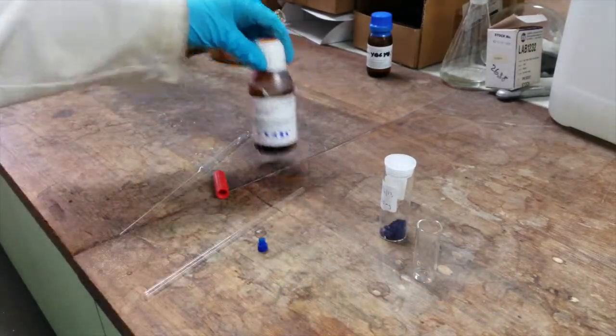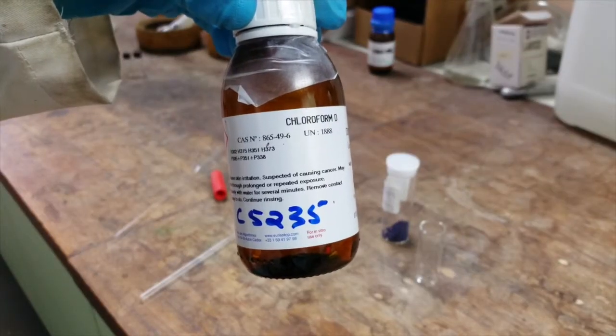You'll also need an appropriate deuterated solvent. In this case we're using deuterated chloroform.